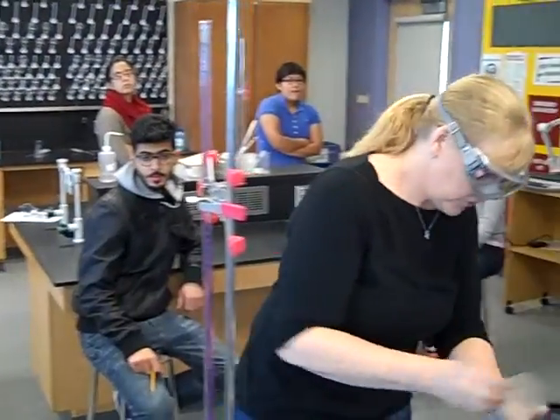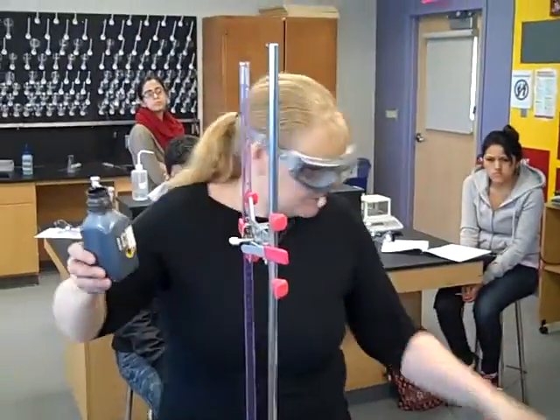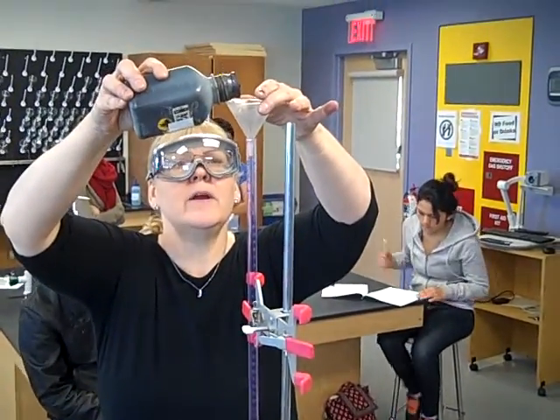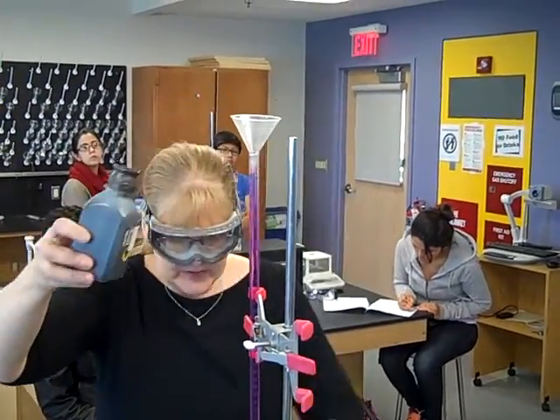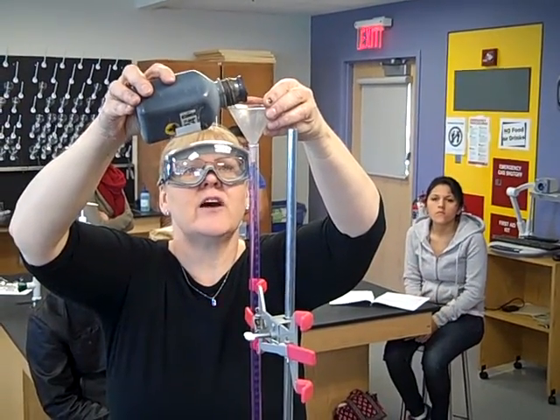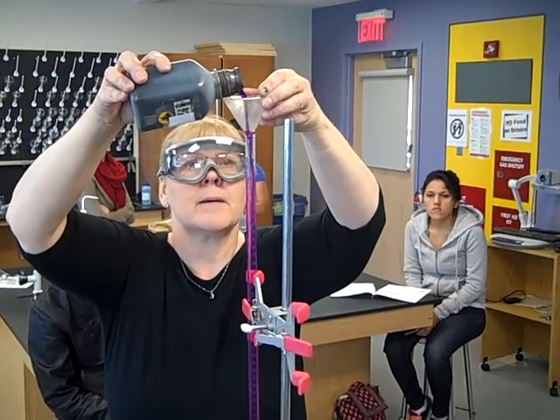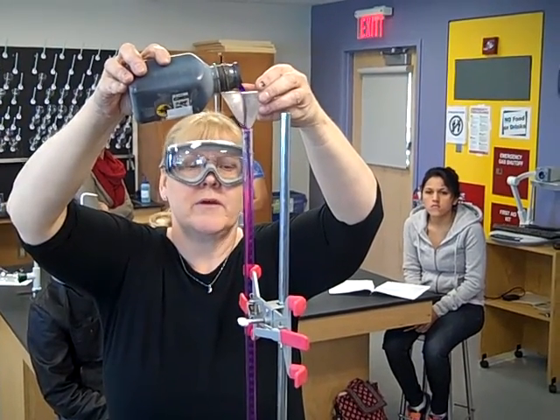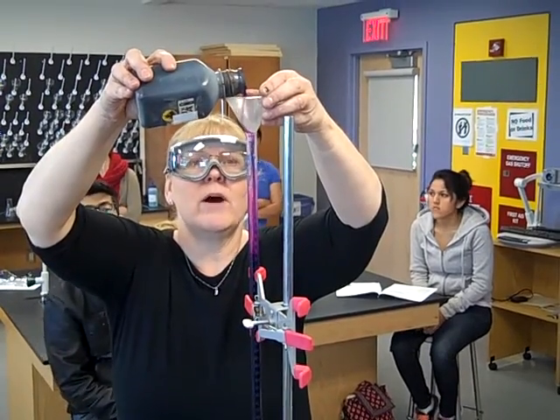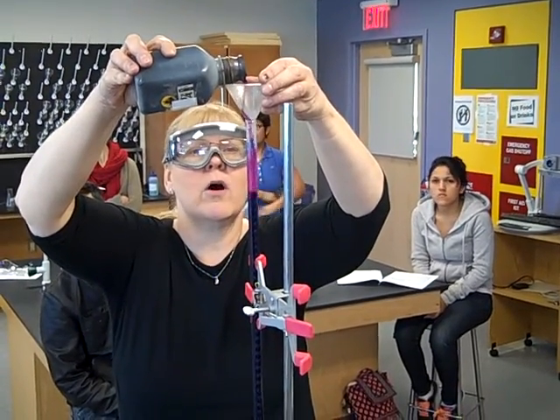Once you've got that done, you're going to fill. To fill, again hold your funnel up. Make certain that this is shut. Fill carefully — if you're vertically challenged, get some help. When you fill, never put a lot in the funnel at once because otherwise, trust me, it will pour all over.